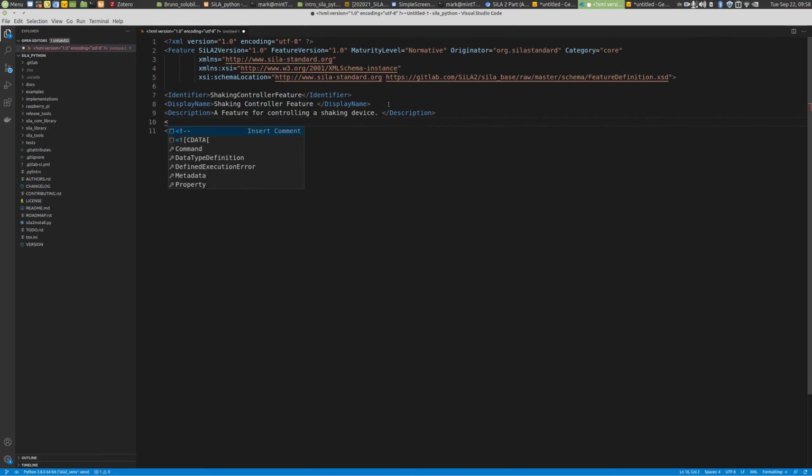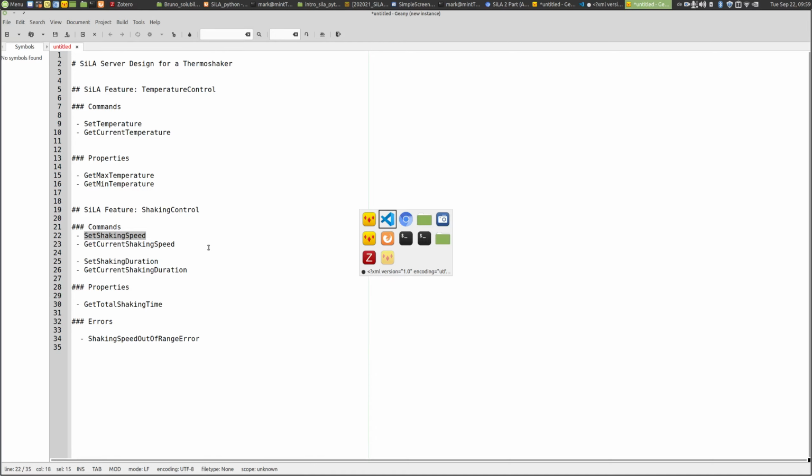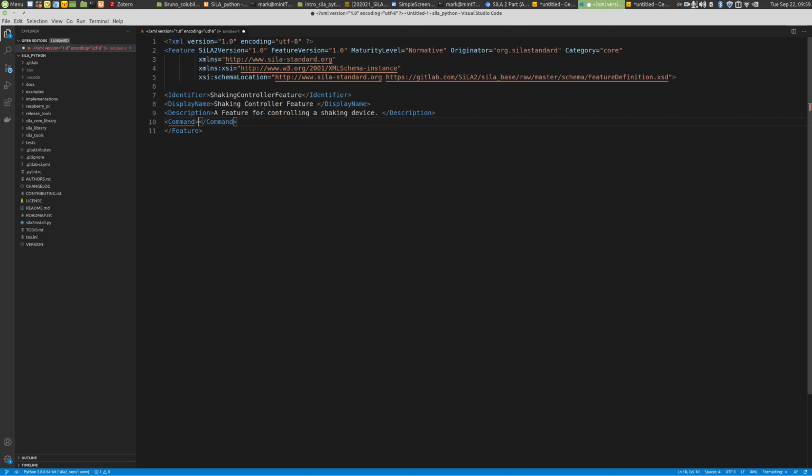So, okay, the next part will be, and here you can now select between command, data type definitions, defined execution error, and metadata property. We'll start with command. So let's just go back to our draft here. This is exactly the same structure as we want to implement, and here's the first command. So command, I'll just copy that. It's easy if you have already written it.